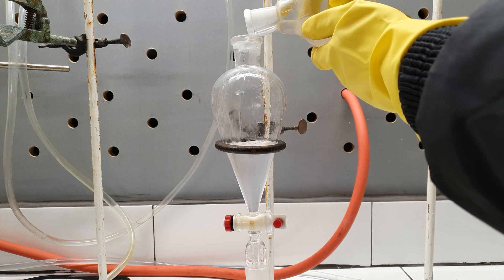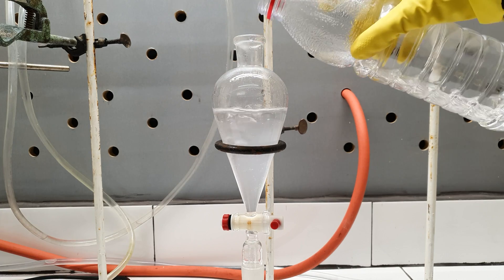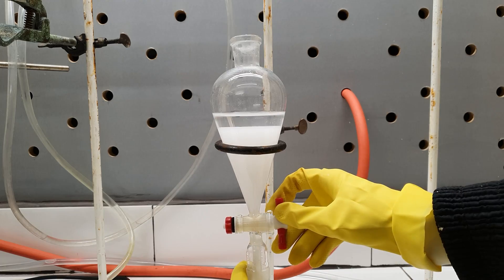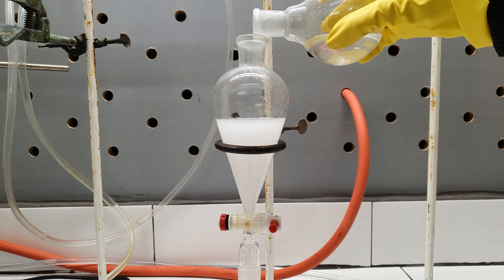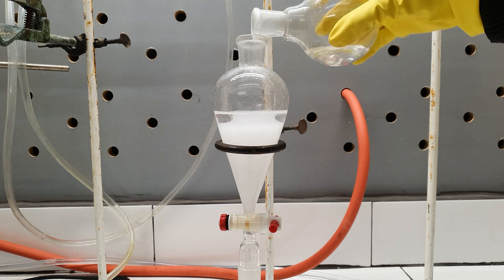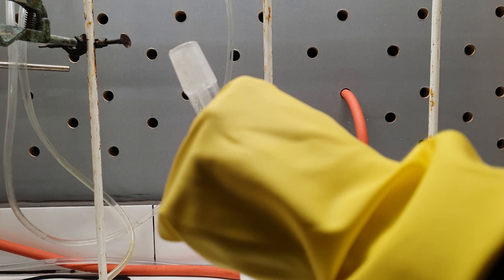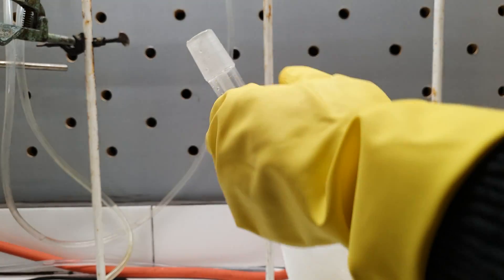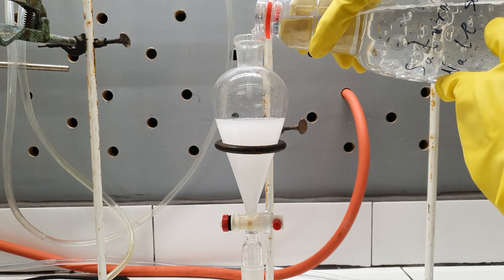Next I washed the bromobutane with about 30 ml of concentrated hydrochloric acid. This is done to remove any unchanged alcohol. The bromobutane is again the lower layer and is collected. Another washing step was done, this time with water, to remove most of the hydrochloric acid. This is done to prevent a vigorous reaction during the next washing step, which is with a saturated solution of sodium bicarbonate. When washing with sodium bicarbonate, excessive care must be taken not to build pressure inside the funnel — thus frequent venting is needed. Finally, to remove most of the water and break the emulsion, I washed it with some saturated sodium chloride solution.